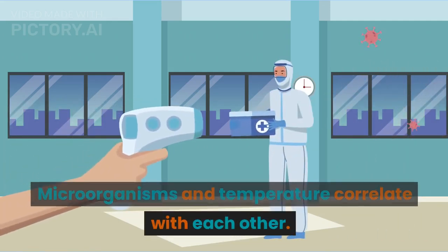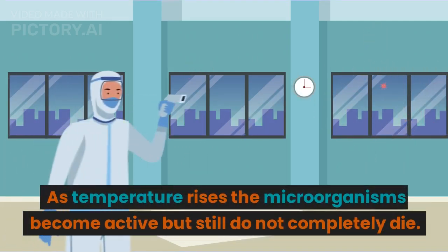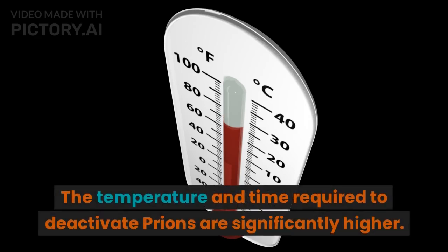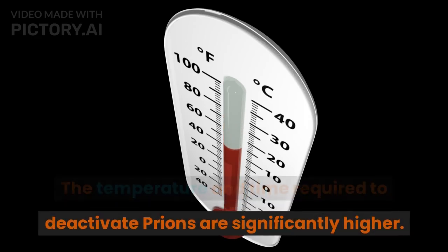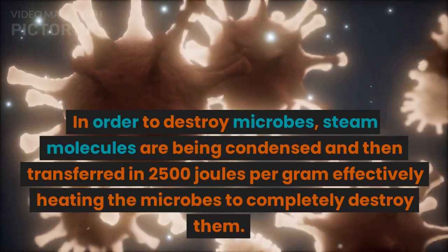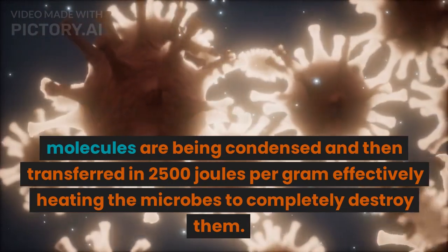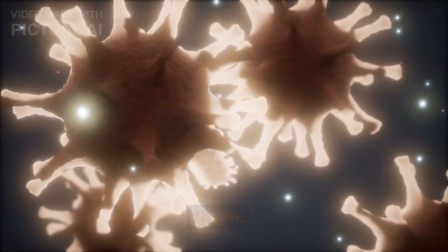Microorganisms and temperature correlate with each other. As temperature rises, the microorganisms become active but still do not completely die. The temperature and time required to deactivate prions are significantly higher. In order to destroy microbes, steam molecules are condensed and then transfer 2,500 joules per gram, effectively heating the microbes to completely destroy them.